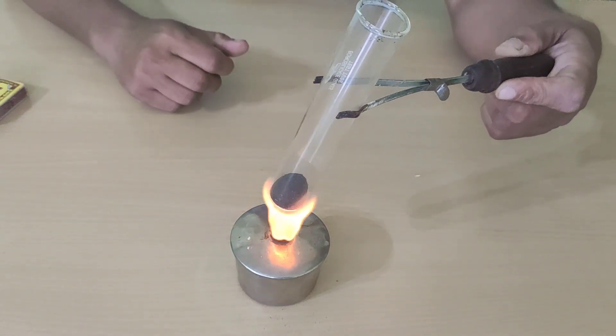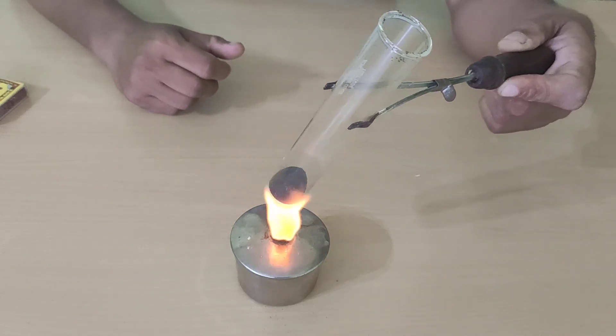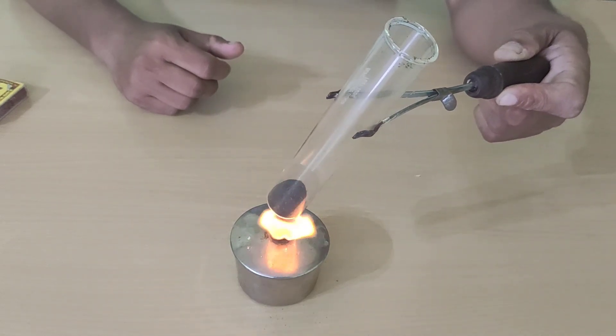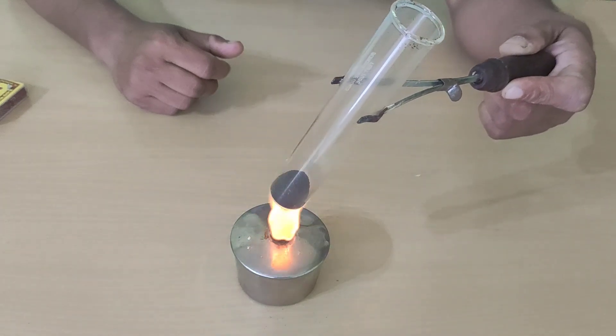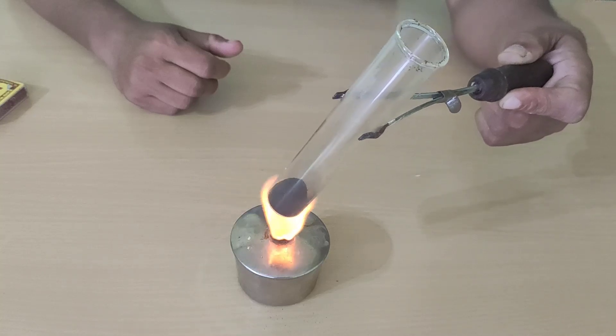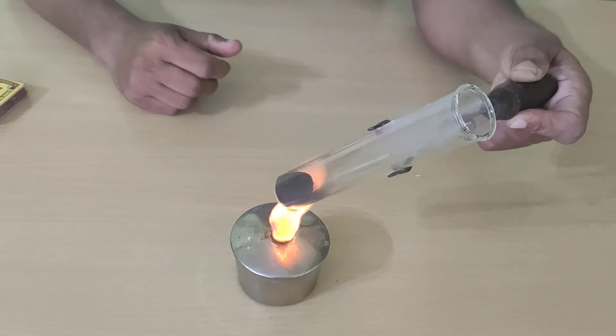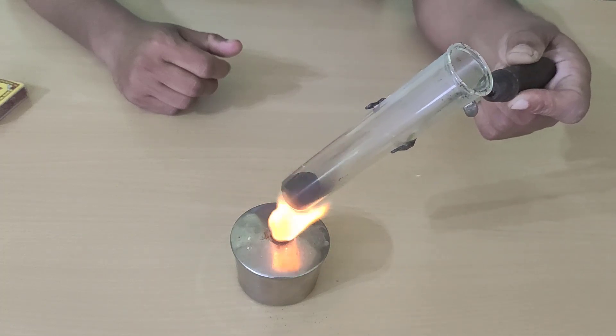After heating, a crackling sound occurs and some smoke is getting formed in this test tube. As the powder is getting heated, smoke is being formed.